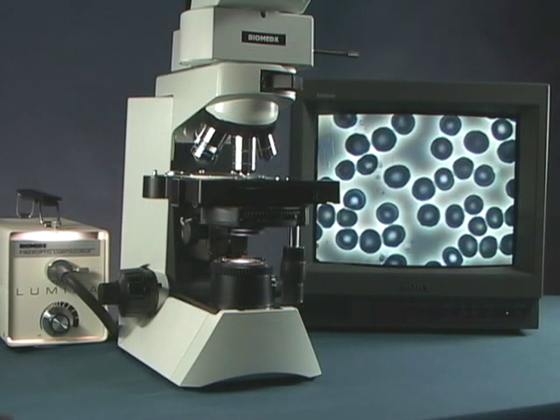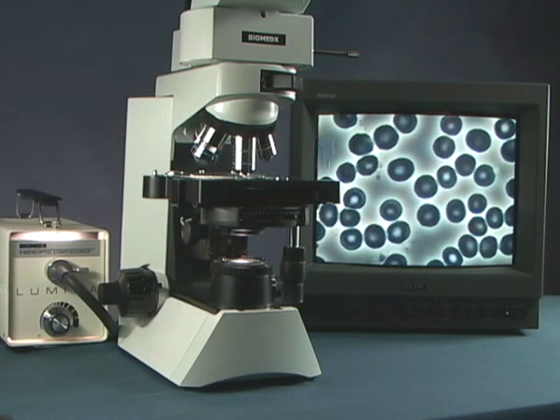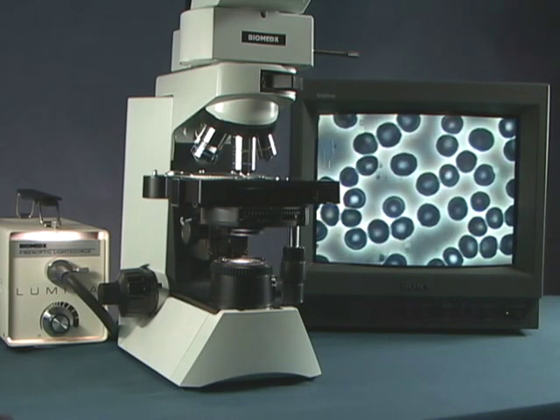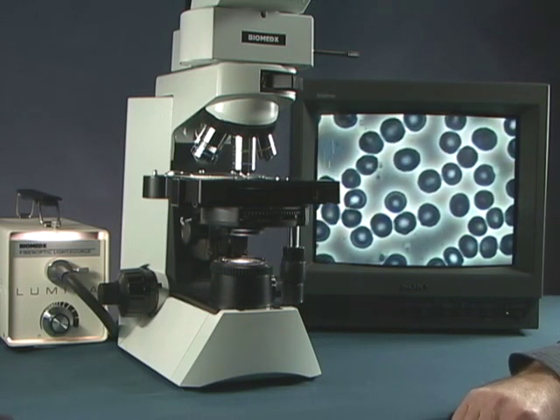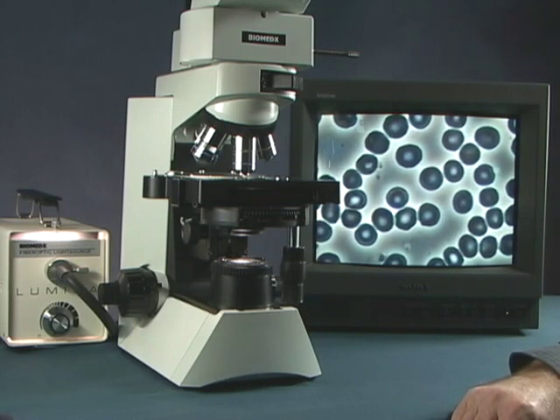Now, if you don't have a centering telescope handy, but you are familiar with getting good phase contrast, you can actually adjust things just by your eyeball.